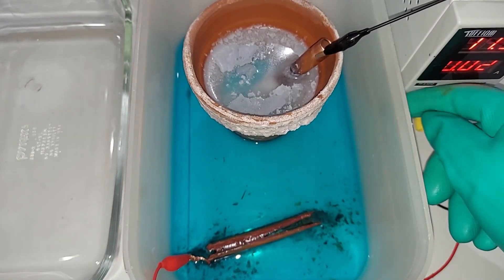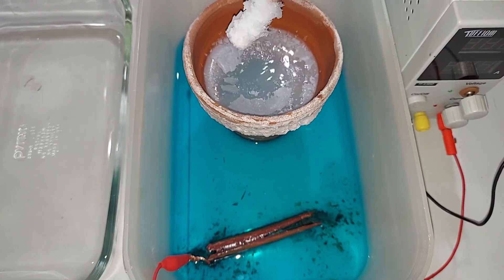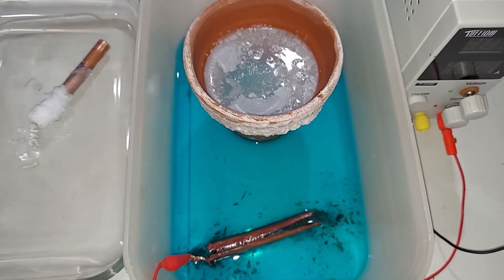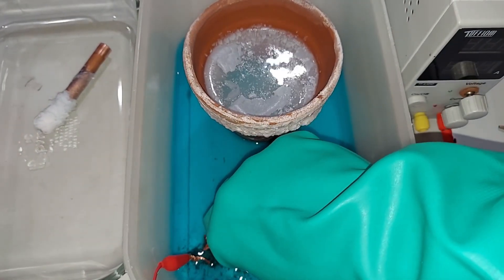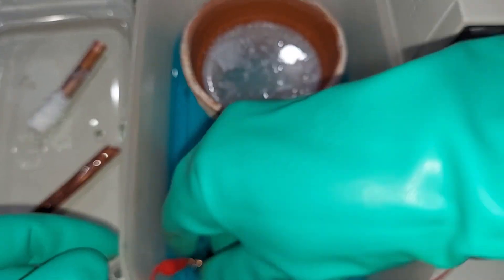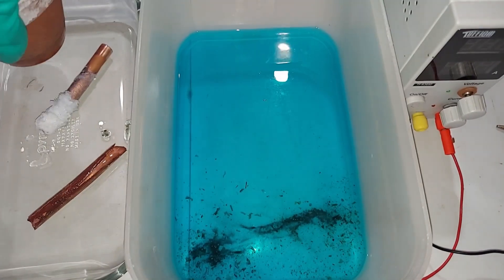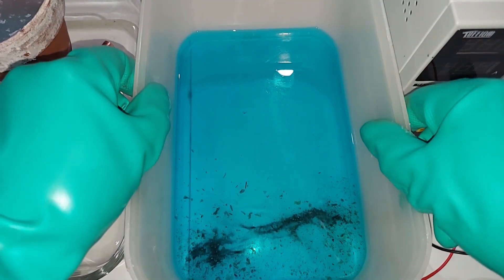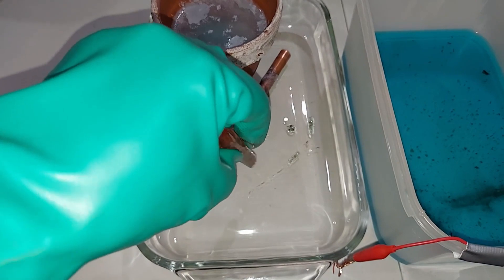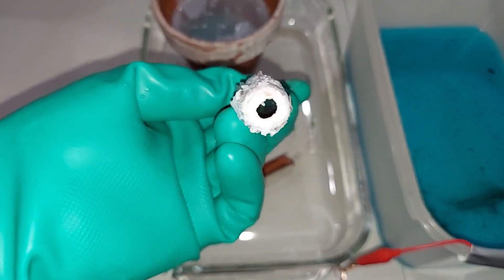We're going to turn this off. First, I'm going to take this out — look at all of that magnesium hydroxide. That's a nice secondary component to get out of this. Then I'll remove the copper pipe since it's free from the clip to the electrode. Now what happens next is it needs to be filtered. Looking at how much the copper was eaten into, you'd expect that. Here's our magnesium hydroxide — it's even clogged the pipe pretty well.